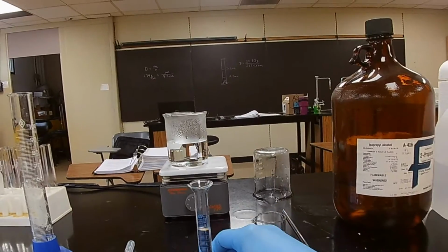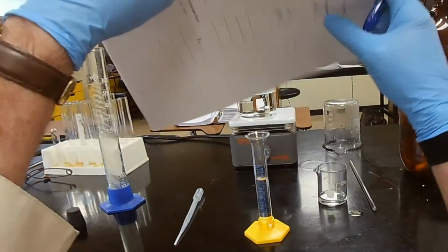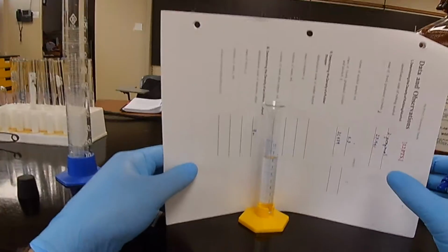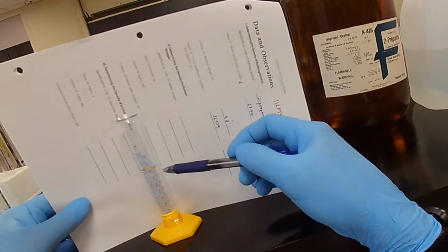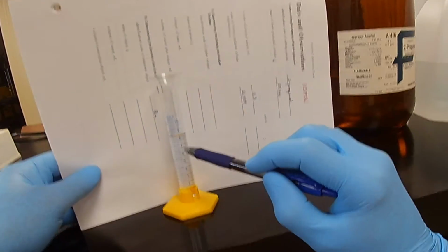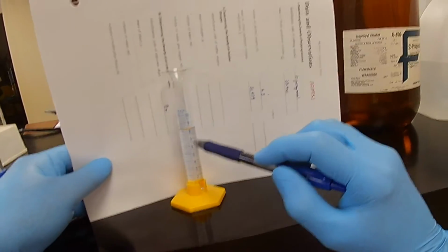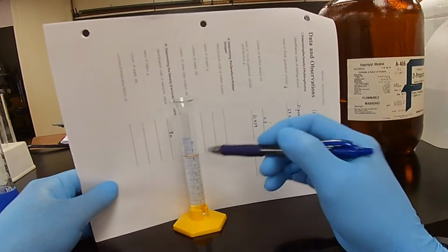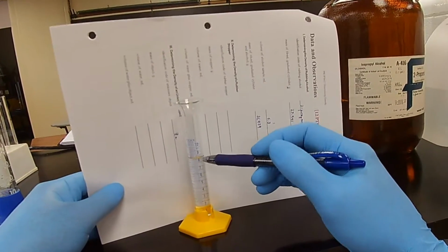Okay. Now, at eye level, got to get eye level. One thing about these graduated cylinders is you'll notice that every so often you have a line that goes all the way around to the back. That's so if your eye is not level with the line in front, you'll see 2 lines. If your eye is level with the front one, 2 lines will disappear. So that helps you keep your eyes level. So let's move up. All right, we're level with this one. We need just to be a little bit higher, kind of in between this one, about right there.